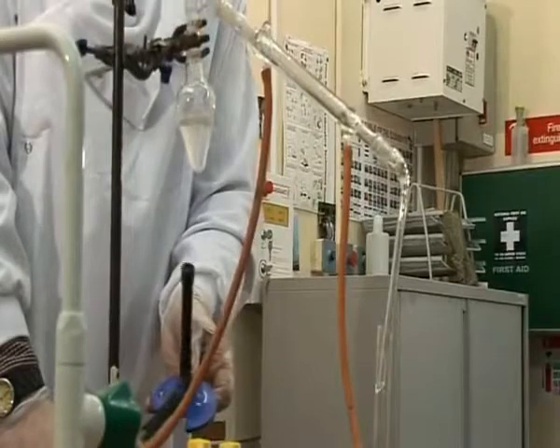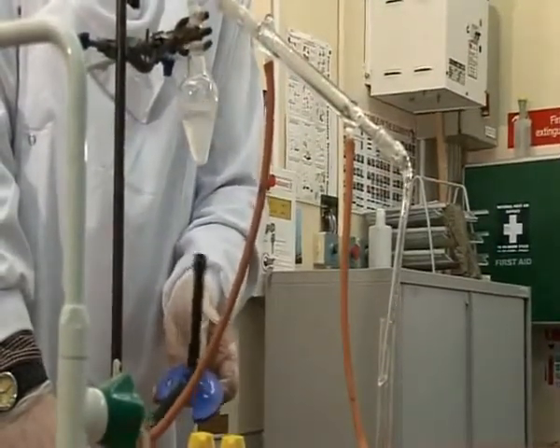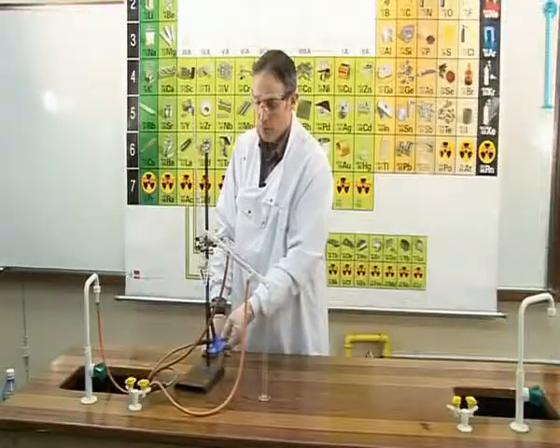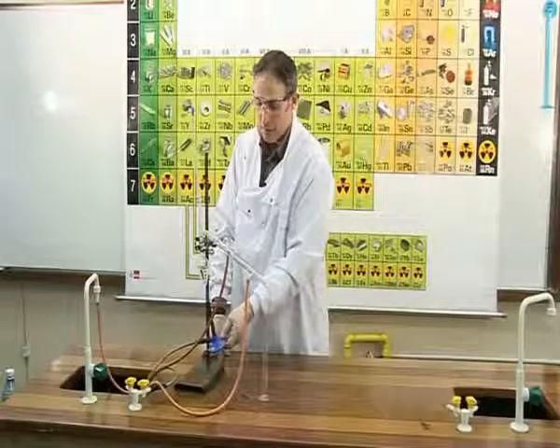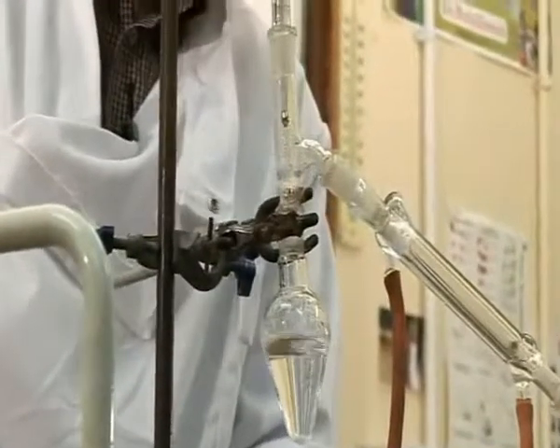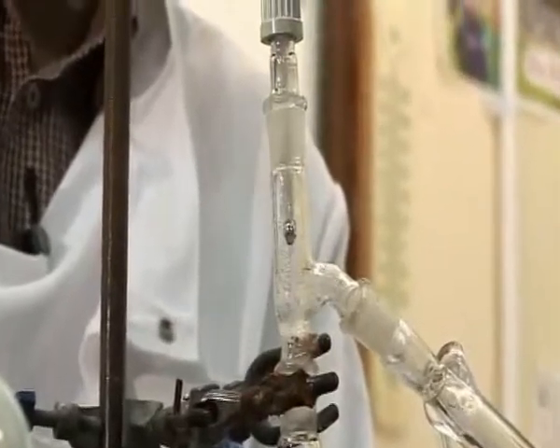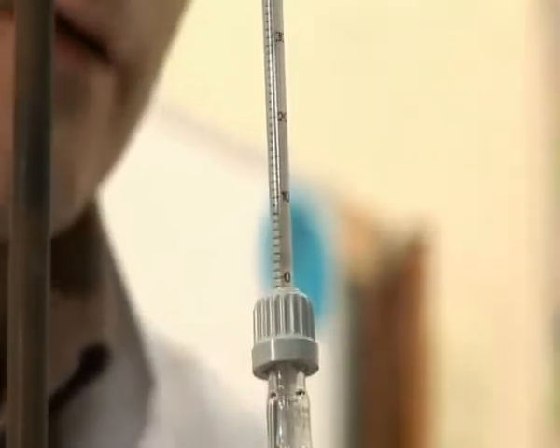It is important throughout the process to monitor the temperature on the thermometer, that it does not reach 100, as at that temperature both liquids will boil. We merely want it to reach 78 degrees. At that temperature, the alcohol will begin to vaporize. I have put in some anti-bumping granules to ensure that the solution boils smoothly. And as you can see, the alcohol is beginning to boil, so I will remove the heat.